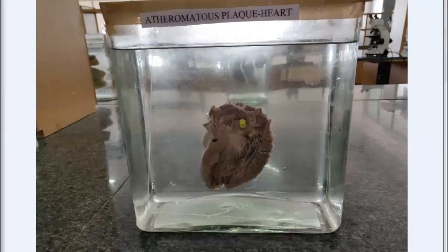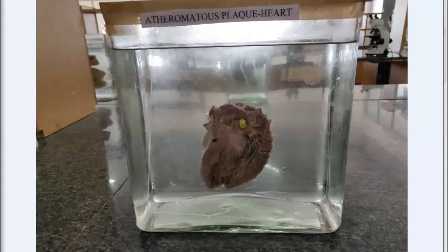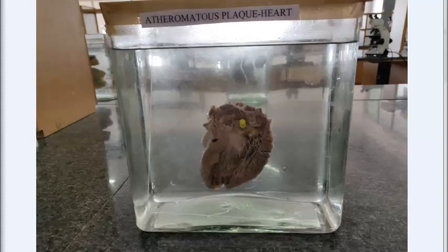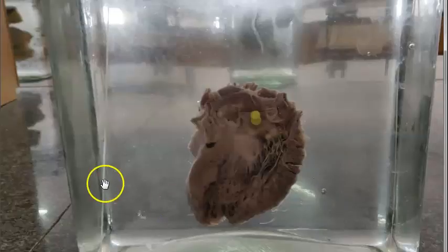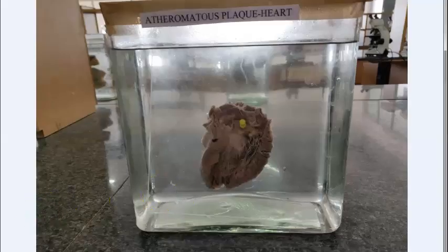Atheromatous plaque of the heart — the gross morphology shows a white to yellowish lesion, one to two centimeters, raised surface. In microscopy, you will see a fibrous cap, a cellular area, and a deeper central soft core with cholesterol clefts.